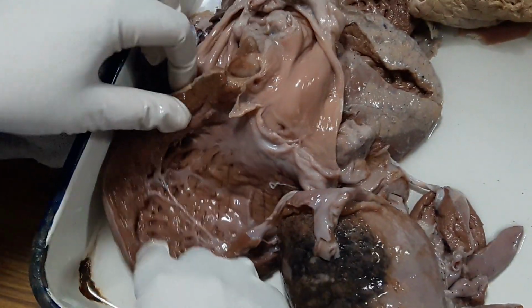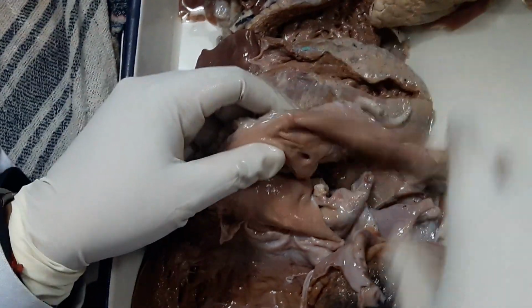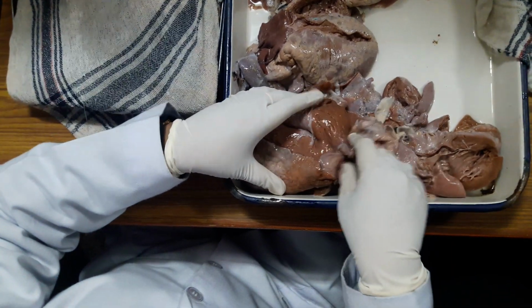This is the aortic valve. Left ventricular cavity is mildly dilated, otherwise it's within normal limits. The main feature of this is fibrinous pericarditis. Can you make out, all of you? Yes, ma'am. Okay.